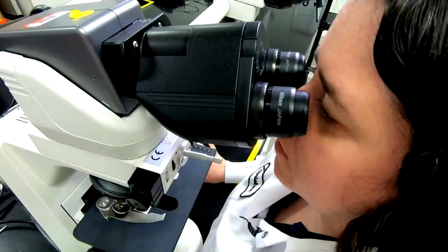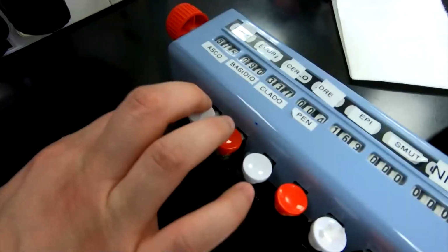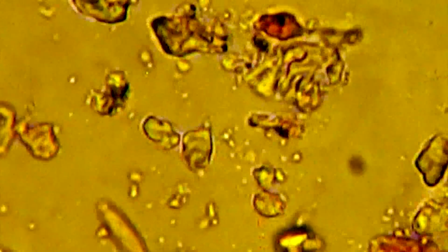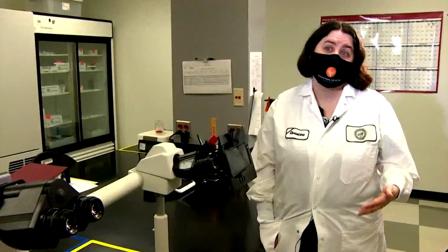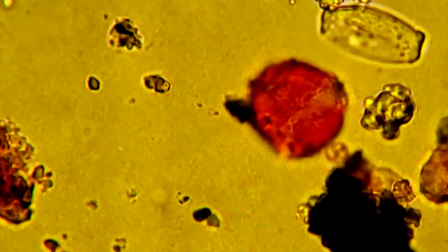We are dealing with microns, and by definition, a micron is a unit of length equal to 1/1,000,000th of a meter. As to how she can tell the different pollen apart. Typically, pollen is either clear or yellowish. We use a dye that is pink to make them pink so that they're easier to identify, because mold is also clear, and when I'm looking at a slide, I'm looking at pollen and mold, and so it's easier to identify the pollen if it's a different color from the mold.